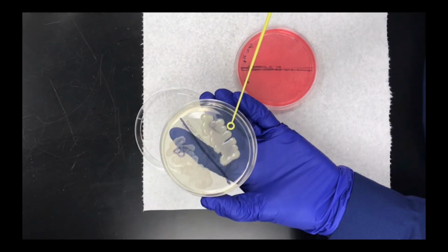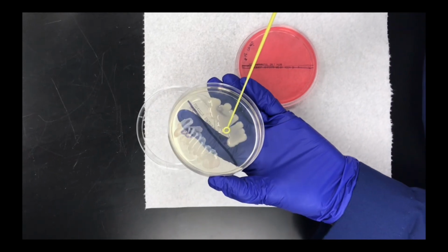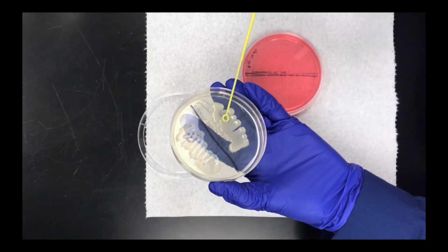You would take an inoculant, that's the plate that has the microbe in it that you're going to use to spread on the new plate, and you're going to use a loop. Loops are used to spread these microbes in specific patterns. One thing you want to notice about this loop is that the head, the circle, is rather large. It's not an extremely small circle. So you take that, and you're only going to use a tiny, tiny bit of the inoculant. You're not going to take a whole bunch, just a tiny, tiny bit.